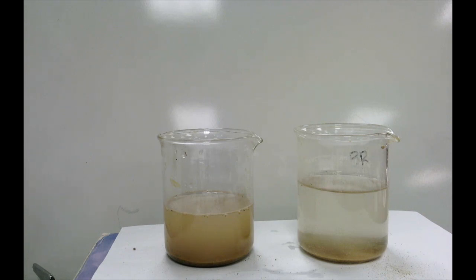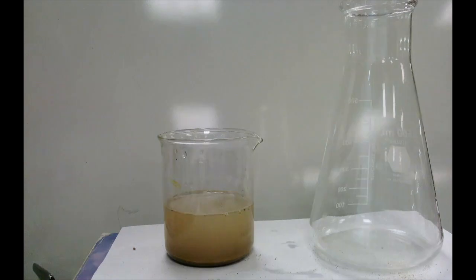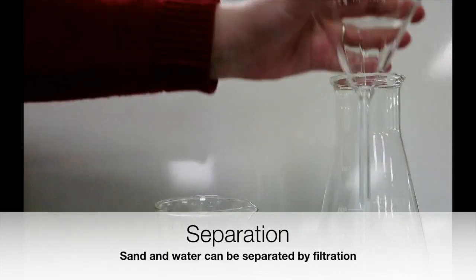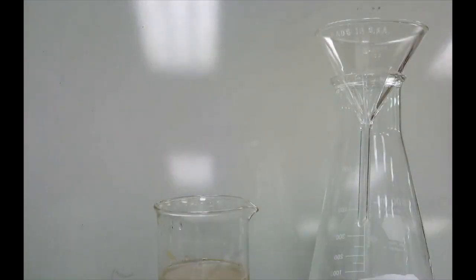The next thing we want to think about is how can we separate this mixture of sand and water? Now, sand and water is pretty easy to separate because you can do it by a process called filtration, where here I'm setting up a little flask, and in the flask I am putting a funnel with a little bit of paper towel to act as some filter paper.